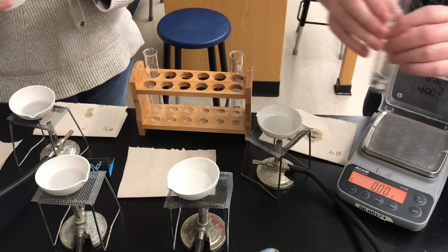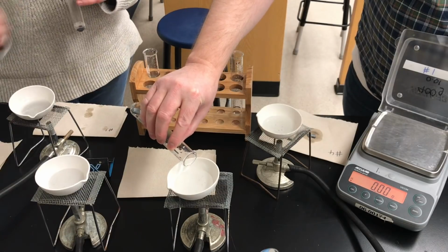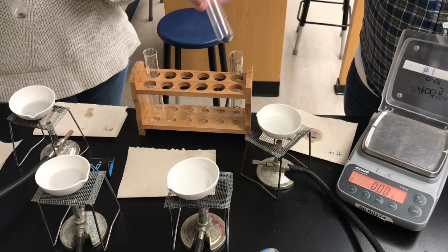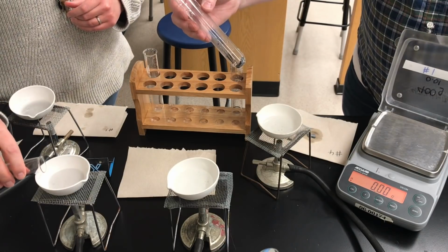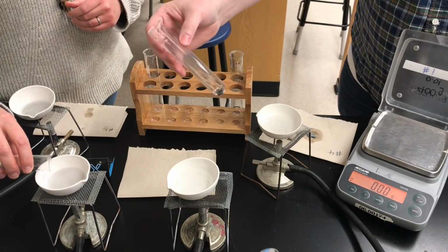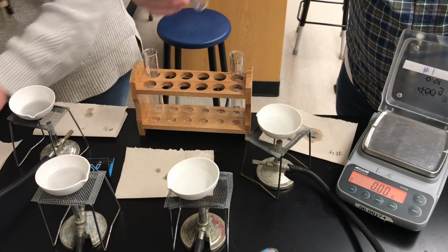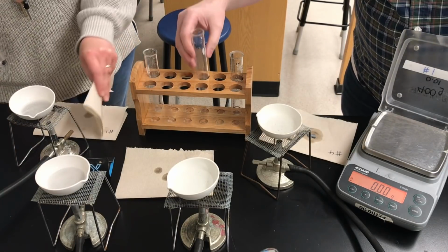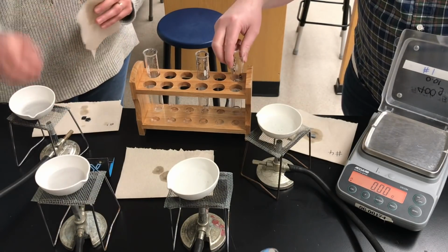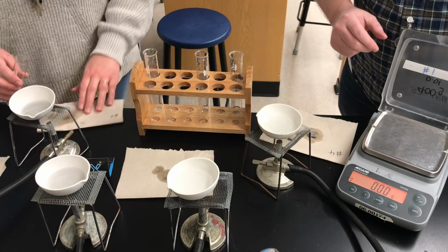Now you don't want to use too much water. The more water you use when you're rinsing, the longer it will take to evaporate afterwards. But if you don't rinse enough, then you're going to be having some zinc chloride stay behind in the test tube, and that would be a source of error. So now I'll shake out that excess zinc, which came out nice and easy, onto its paper towel. So I just have to get this last piece of zinc out of this test tube onto my paper towel, and Ms. Watts, you've got yours ready to go there.